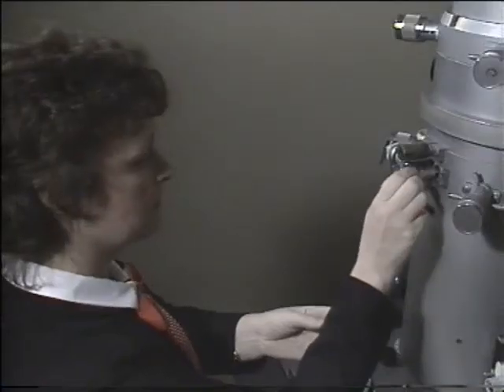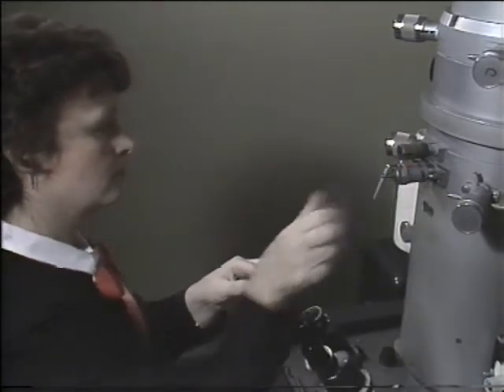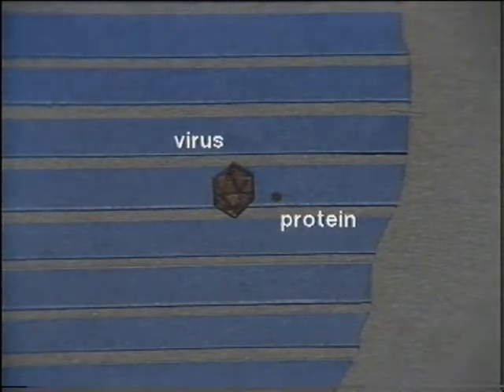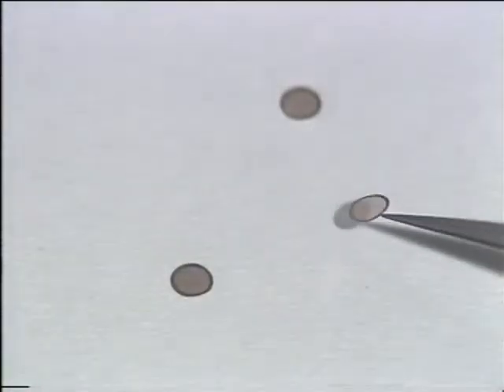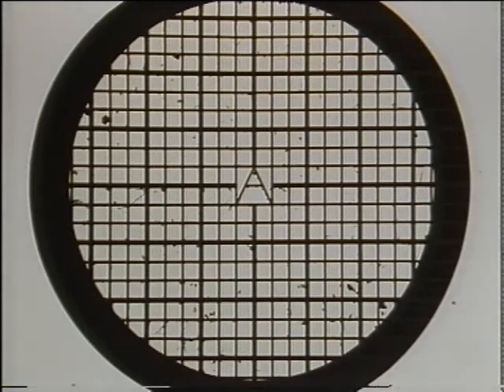The specimens must also be extremely thin so that the electron beam can pass through them. This means that either the specimens must be very small, like viruses or protein molecules, or they must be cut into thin sections, 1,000 times thinner than a piece of writing paper. So that they can be put into the microscope, specimens are mounted on copper or nickel grids, which are only 3 millimeters in diameter. Each grid is made up of a meshwork of open squares. The specimen is supported by the metal lattice, while electrons pass through the holes in between.